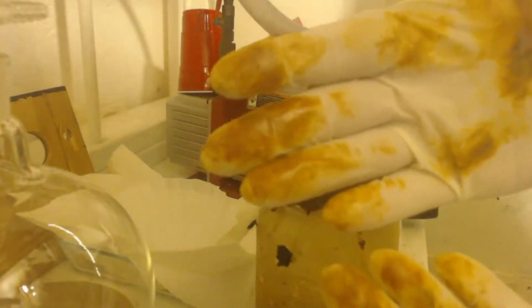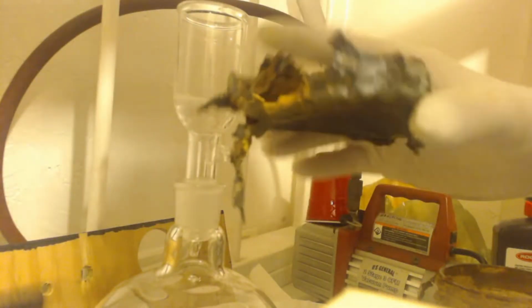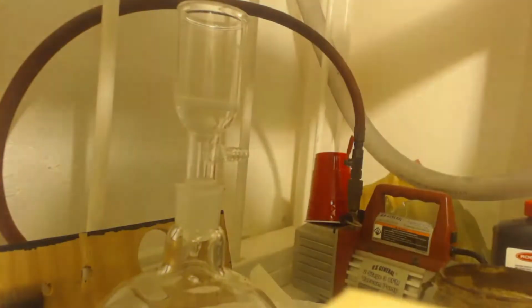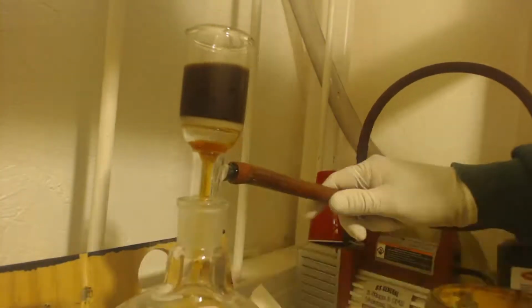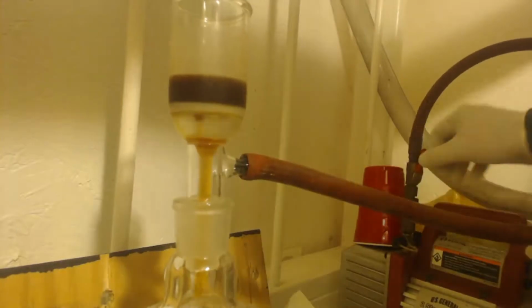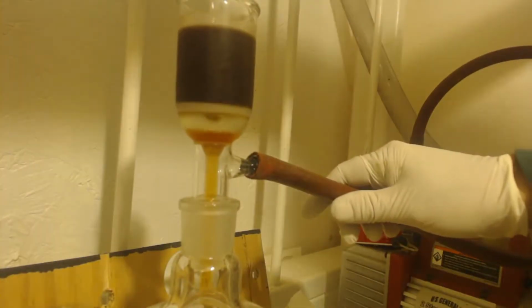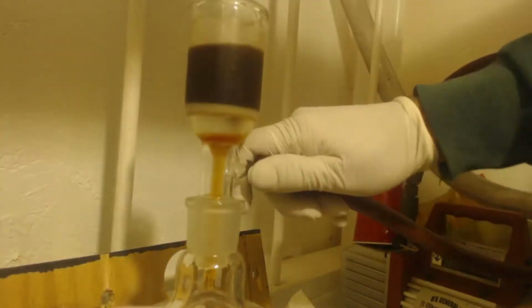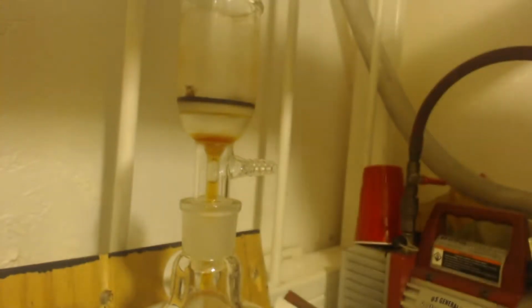See what it's doing to my gloves. Look at that, it just dissolved this tin lid, man. It literally just dissolved it. Oh. Flush it out with some ice cold water.